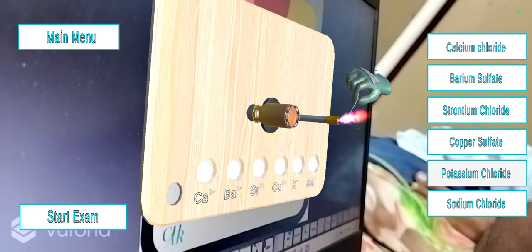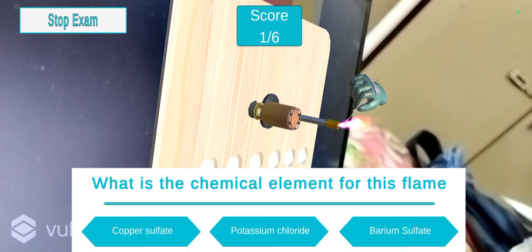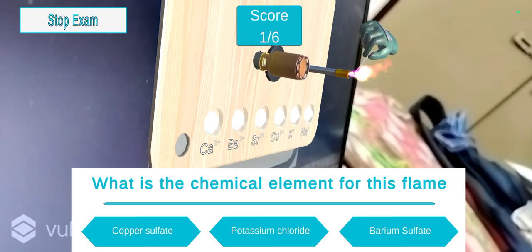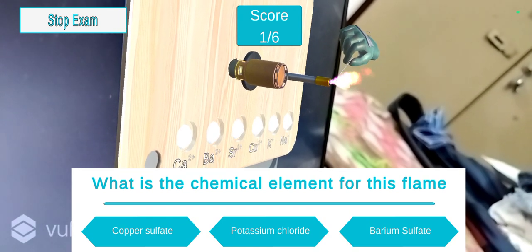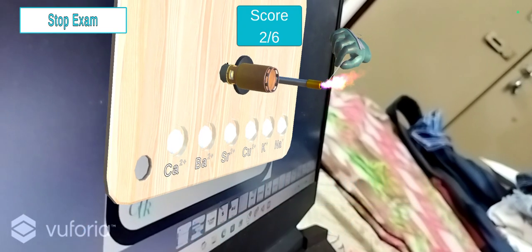And also we had added a section about analyzing your knowledge. We have added this quiz feature for better understanding of students and checking their capabilities. Also, you can see here the purple color flames, which is potassium chloride. If you click on potassium chloride, it says yeah, you are correct. So it goes to the next compound.